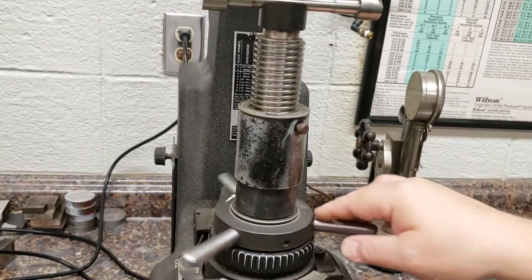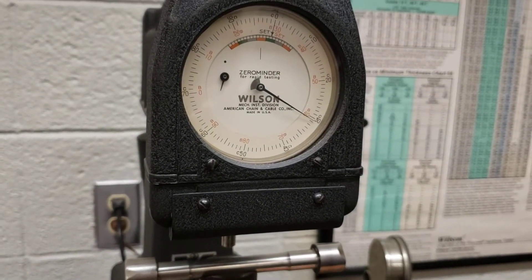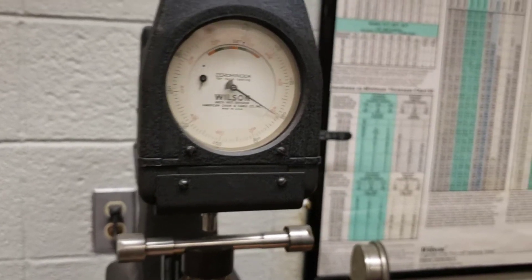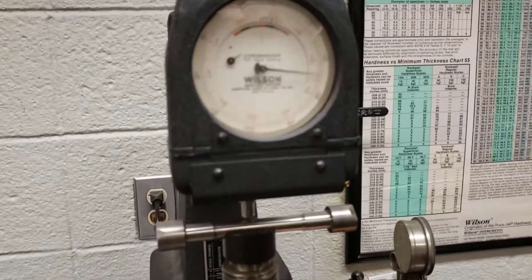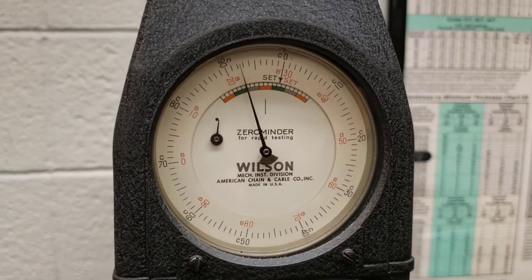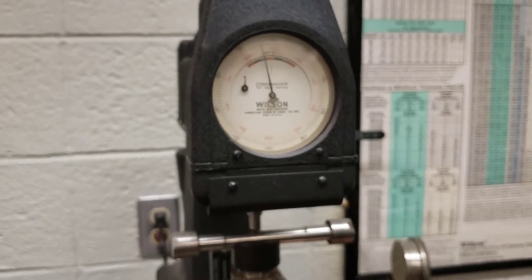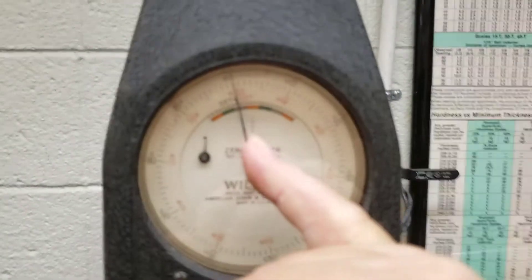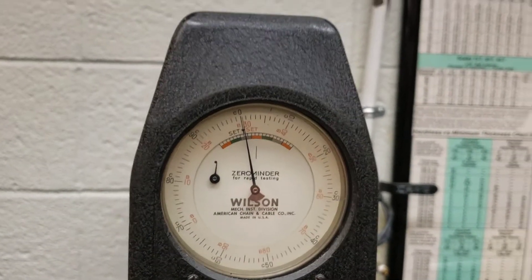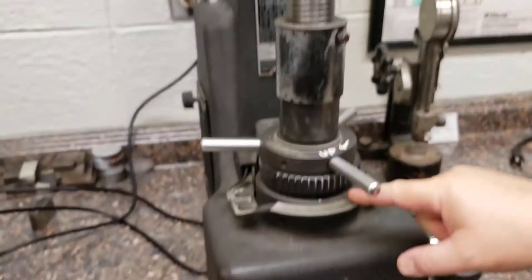Bring the sample up. We're going to be using this small dial on the left, and the goal is to put that dial needle into the black dot — that's the preload. So spin that black little dial into the center, like that. The large dial can be zeroed now. As long as the big needle ends anywhere in this colored range, it is acceptable. Preload is set, dial is zeroed. Press the trigger lever and wait.